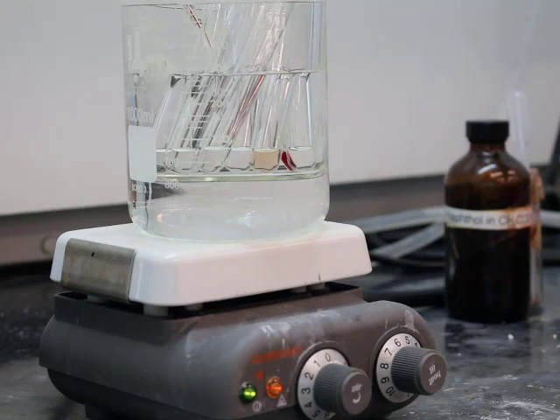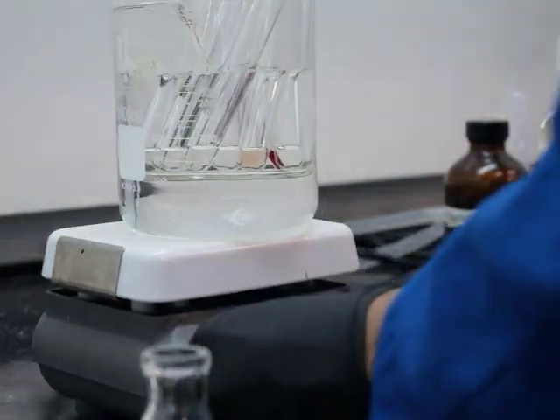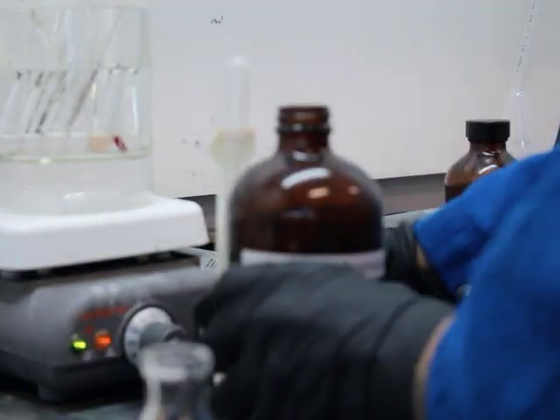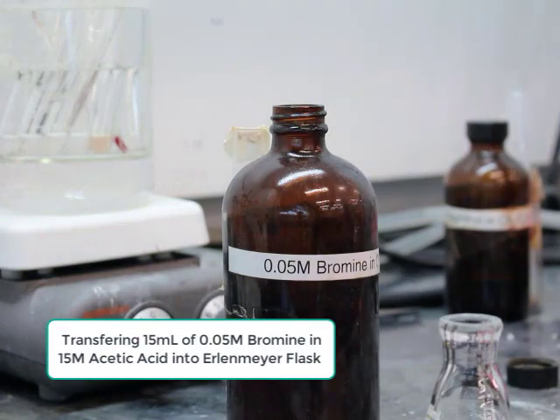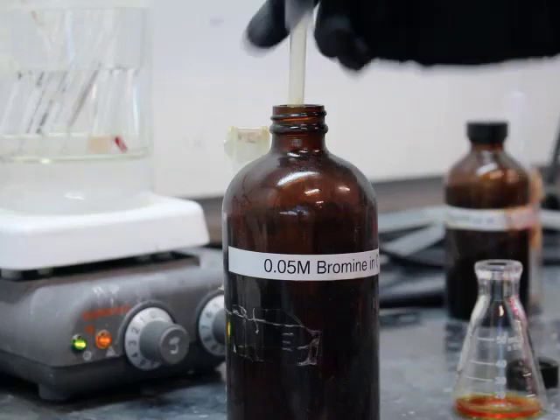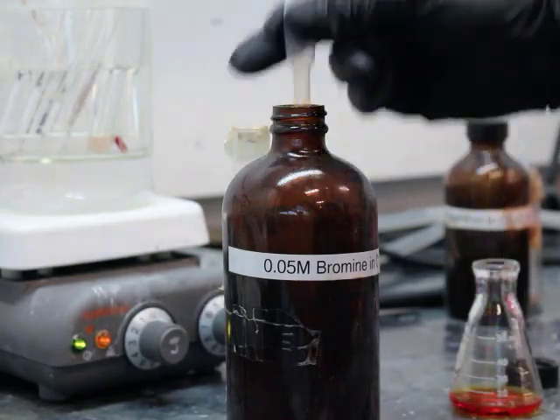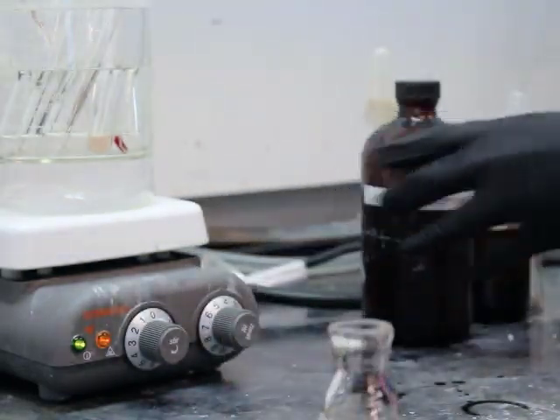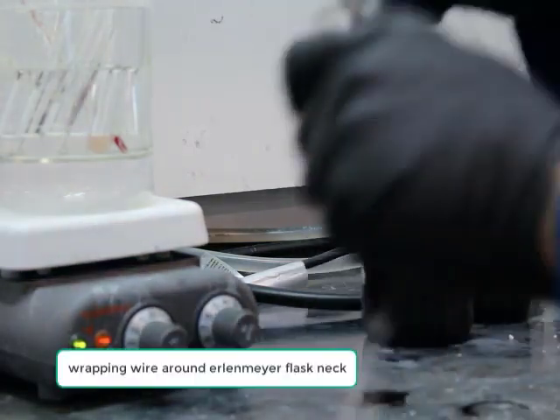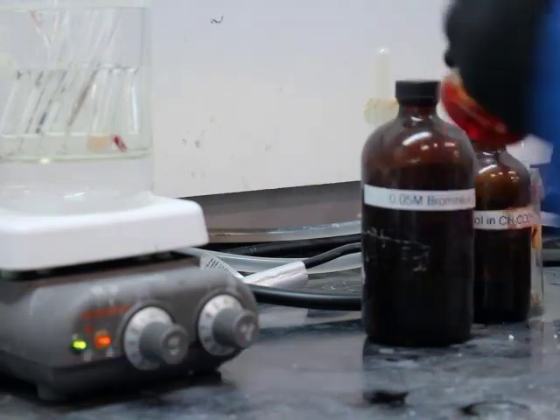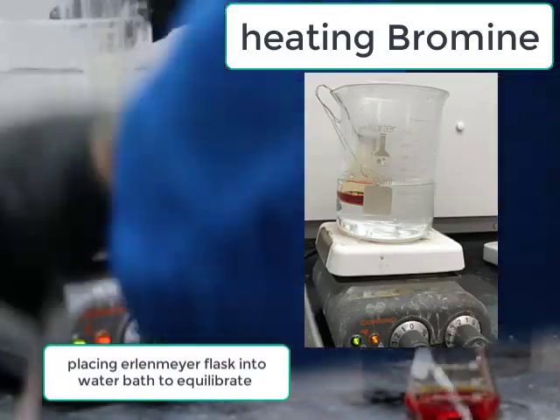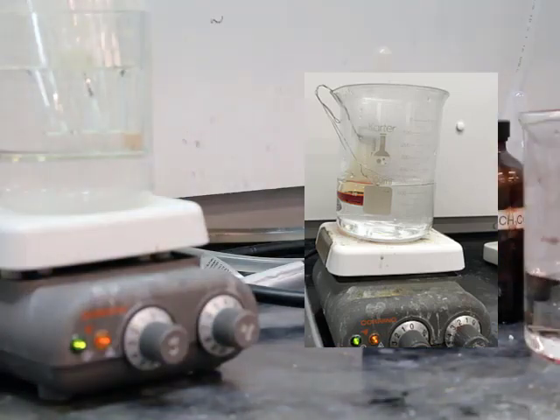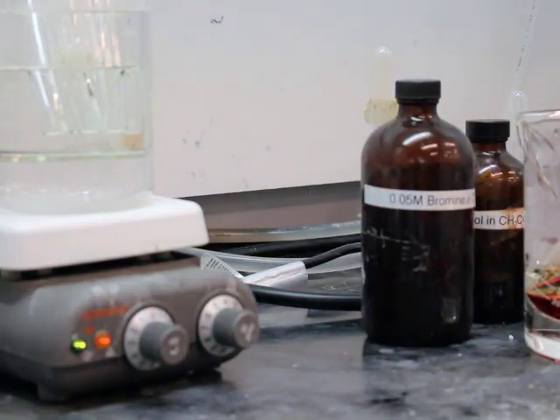The big thing to remember here, it's not going to be a huge change in color per se. Bromine is going to be kind of a brownish red color. The TA is prepping the bromine, pouring a large quantity of it into an Erlenmeyer flask that can then be put in a separate hot water bath so that we can equilibrate the temperatures of the two solutions. You want them both to be very close to 35 degrees C. You can see the color of the bromine solution, it's red, vibrantly red. In order to see that a positive reaction or that the reaction took place, you're going to be looking for kind of a more of a yellowish color. When you see the yellow color, that's an affirmative that the reaction's finished.